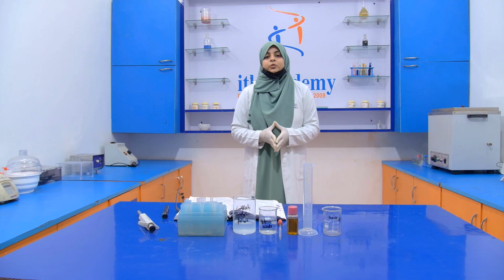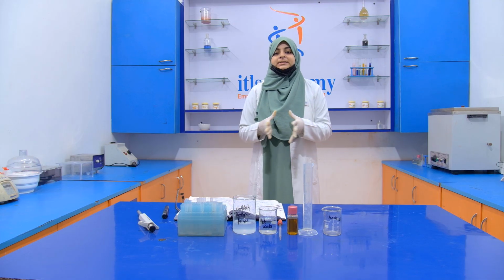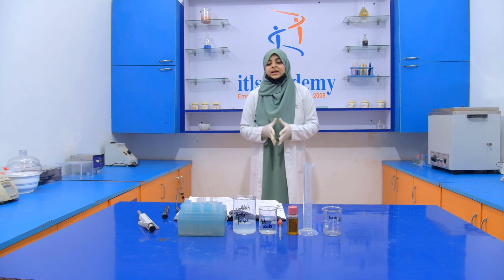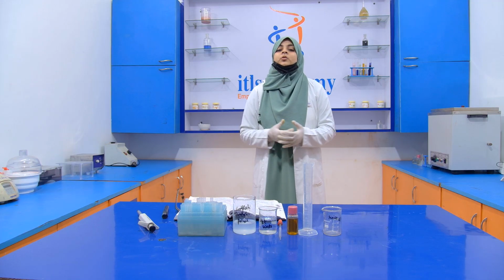Today we are going to perform another adulteration test in our edible oil, and the test that we are going to perform is the detection of mineral oil in an edible oil.